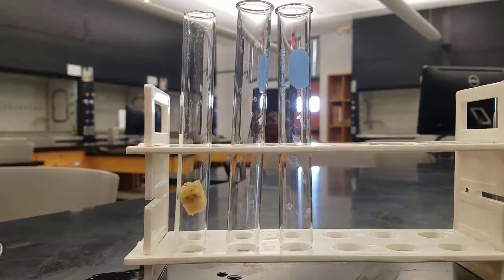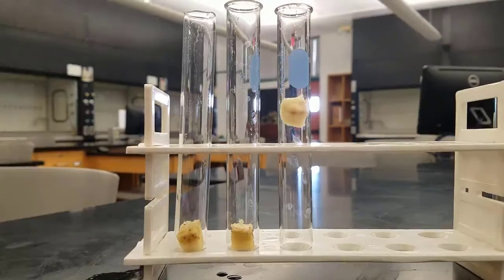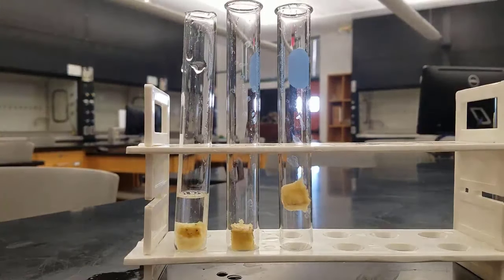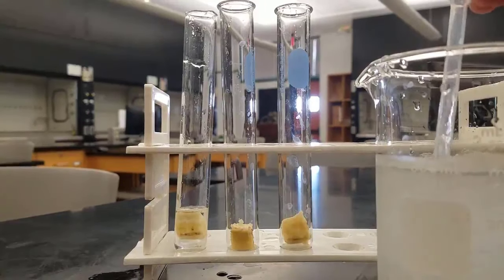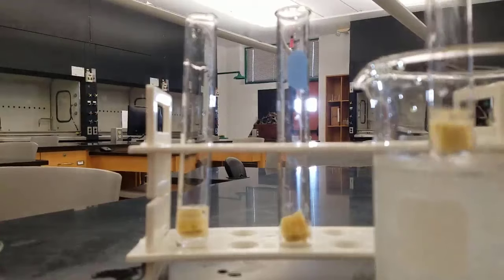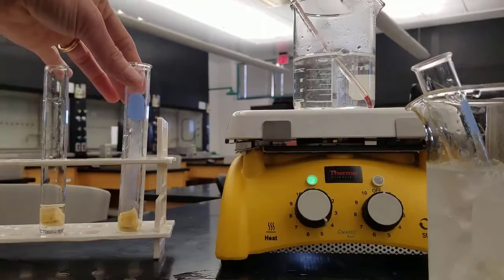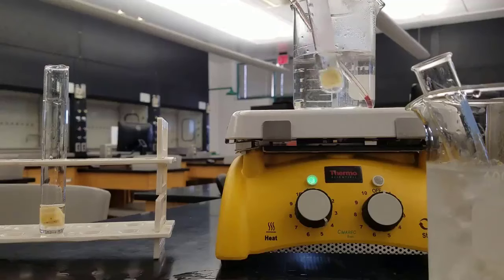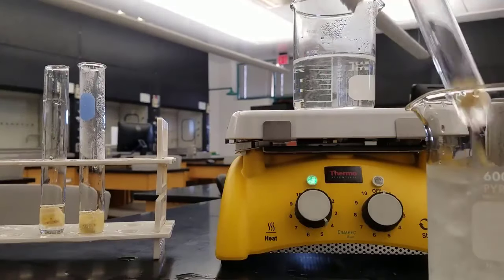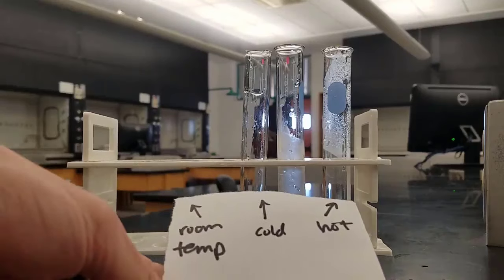We're controlling the banana variable, so we've got approximately the same size bananas. This experiment is very qualitative — I didn't weigh the bananas out, but we're just doing it simply to start with. We're going to add room temperature water to the first banana, then get some ice water and add it to the second banana. Remember, your catalase is in the banana, so we're changing the temperature of the enzyme. The enzyme in that second test tube is getting very cold. In the third test tube we add some hot water and put that banana into a hot water bath. We let those sit for about five minutes — so room temperature, cold, and hot.